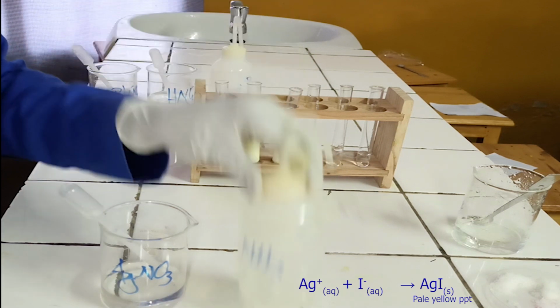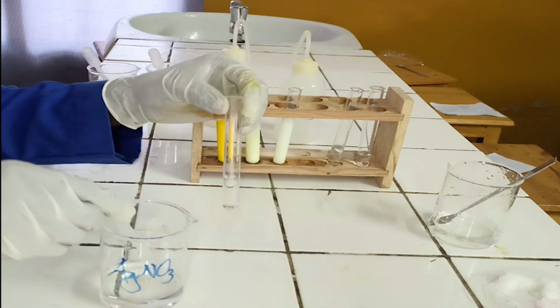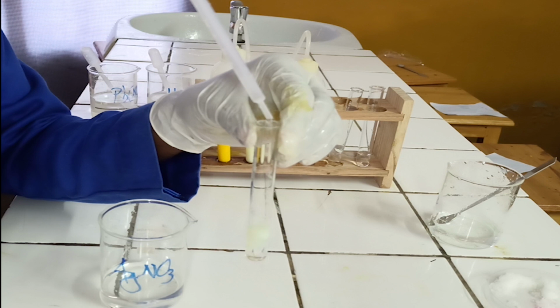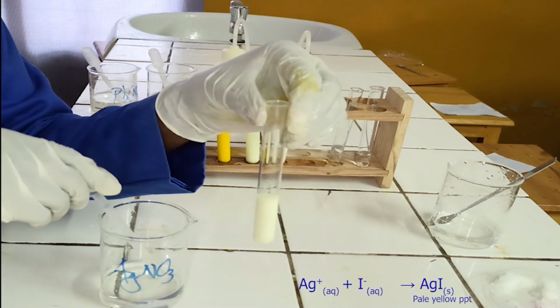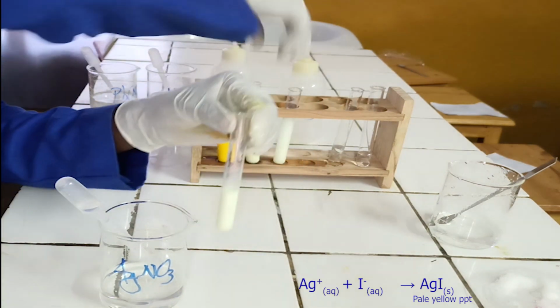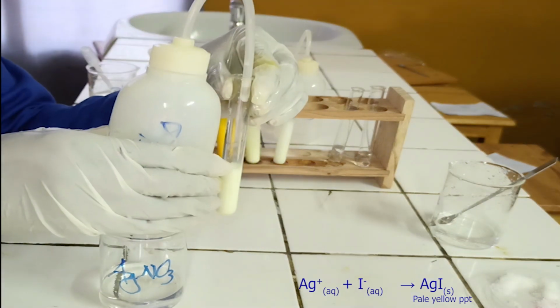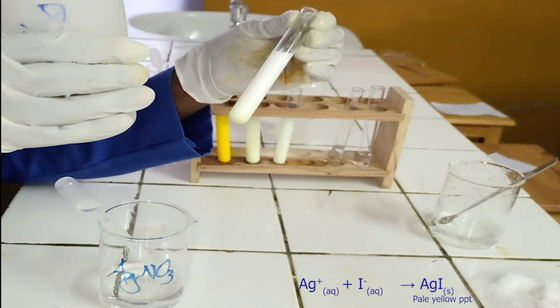Confirmatory tests. First confirmatory test. To the fourth test tube, add silver nitrate solution followed by excess of concentrated ammonia. As you see, silver nitrate solution reacts with iodide ion to form pale yellow precipitate. The pale yellow precipitate formed is insoluble in concentrated ammonia. Below, there is the ionic equation for this reaction.